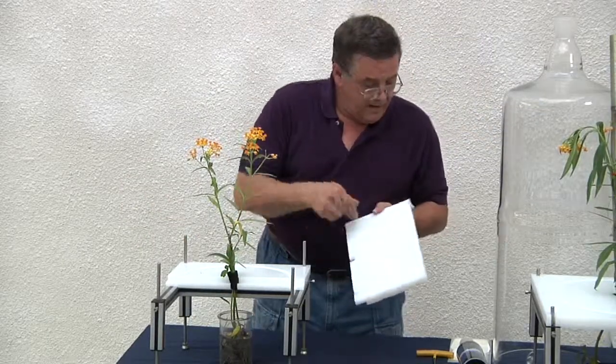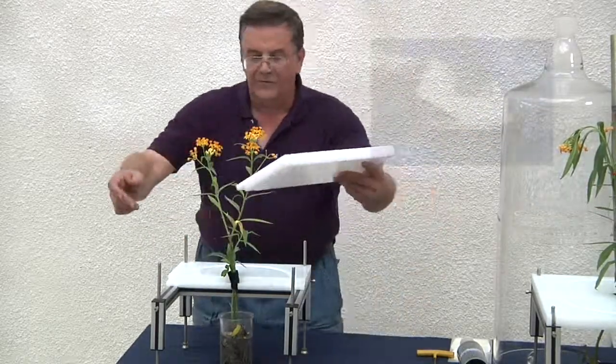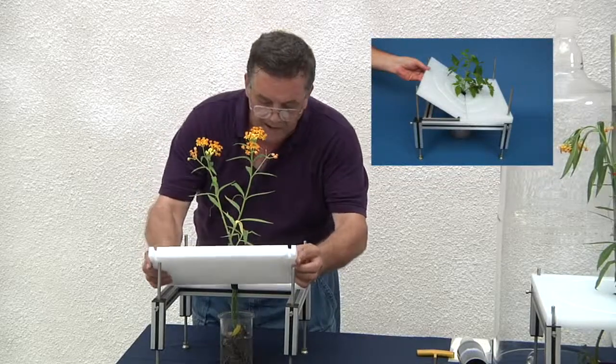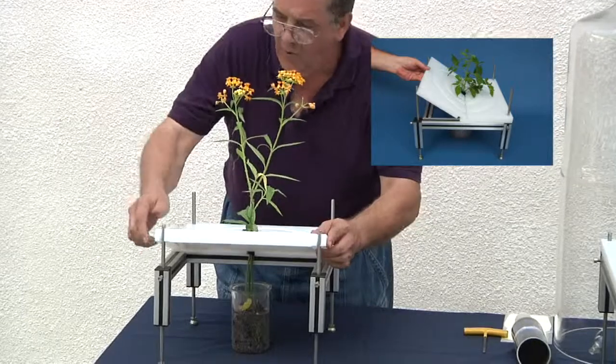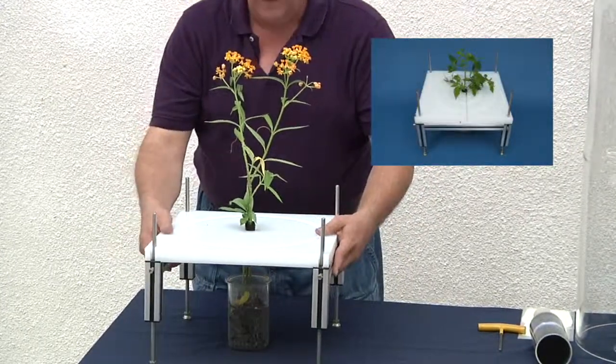The front guillotine has slots. This allows you to attach it by going in at an angle. Bring it forward and it locks down in place.